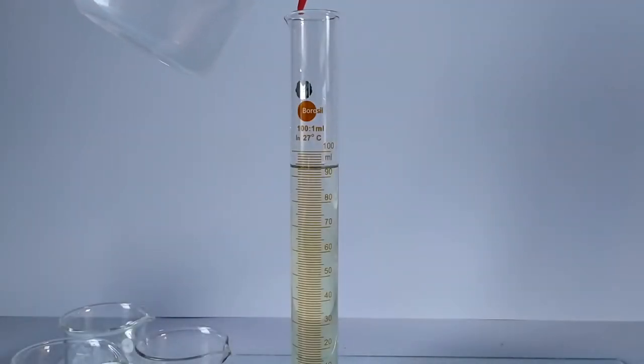Now make up the final volume to 100 ml using distilled water. This is Nessler's reagent, ready to be used for qualitative tests for ammonia and ammonium salts.